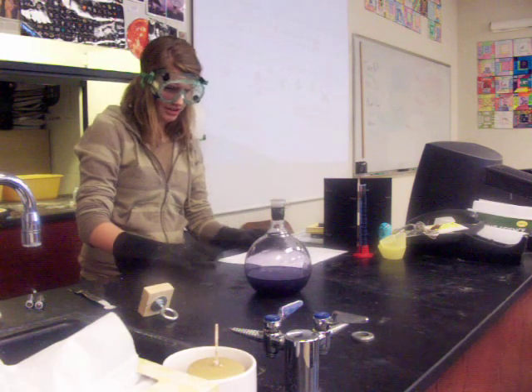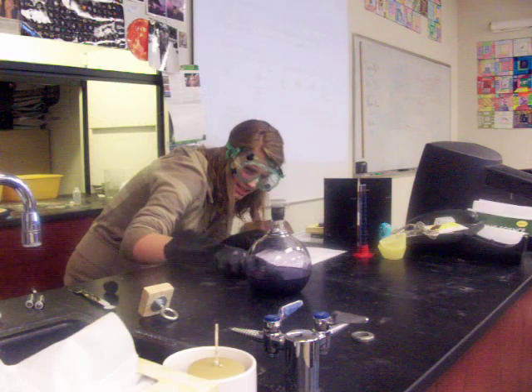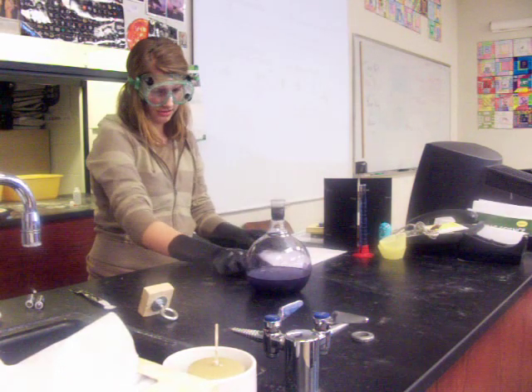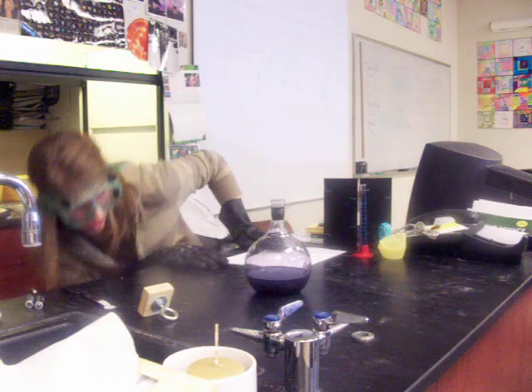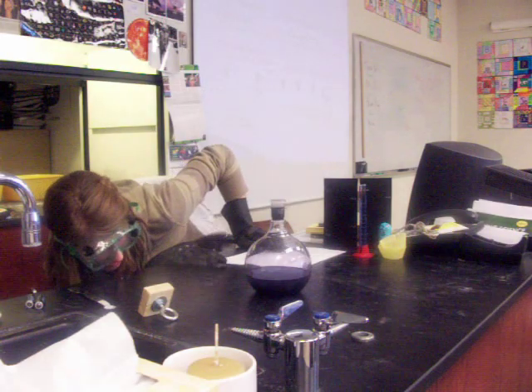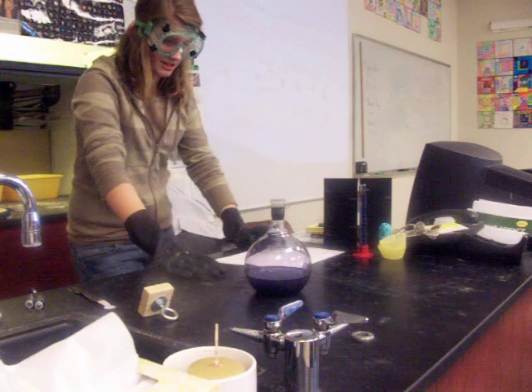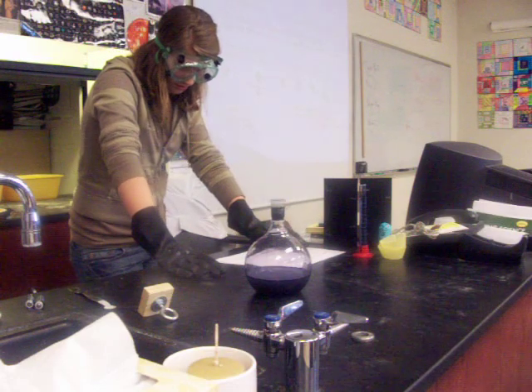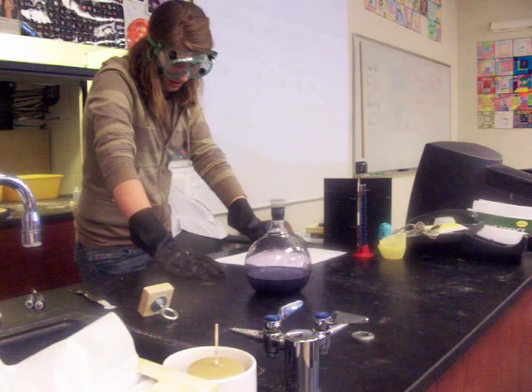But it takes a little while to go clear. You can kind of see it's getting a little cloudier, lighter, but it takes a little while for it to go all the way back to clear, which it will do eventually.